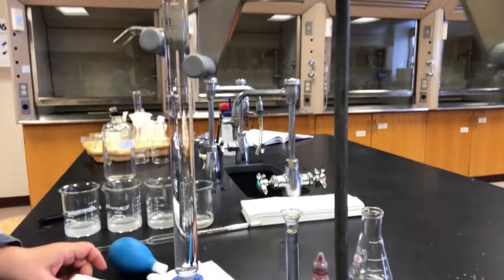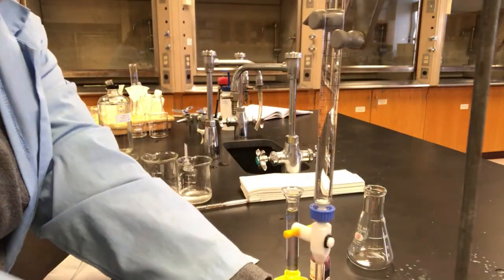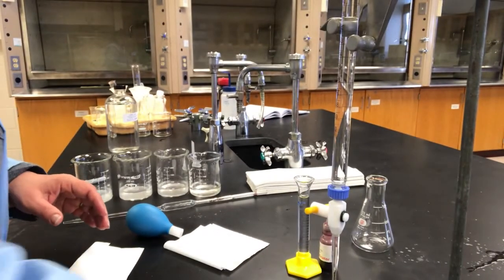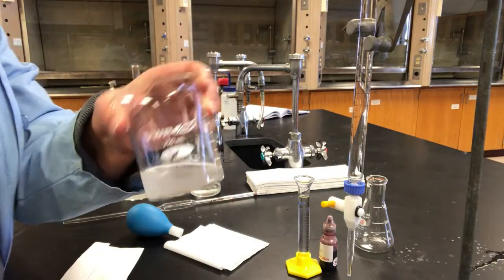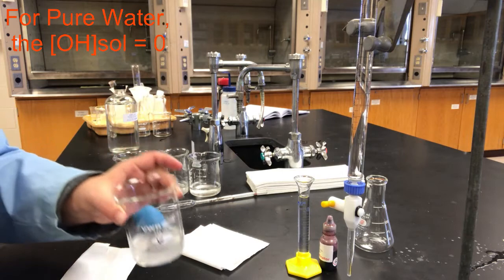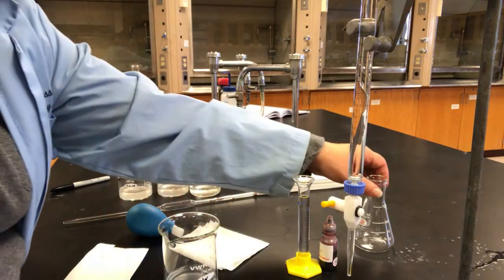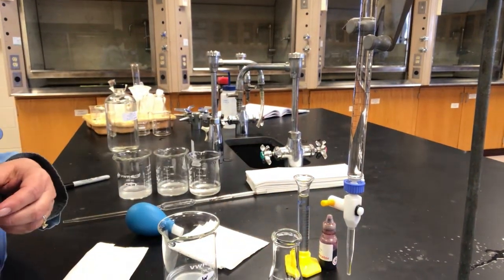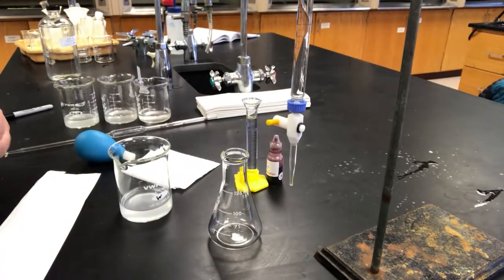So I'm going to titrate, first of all, a sample that was dissolved into pure water. So the pure water one is here. I labeled it W. And it's still slightly cloudy, as you can see. But I did filter it through twice, so we're going to go ahead and do the analysis. First, we're going to start by pipetting 10 milliliters of our sample into this Erlenmeyer flask.